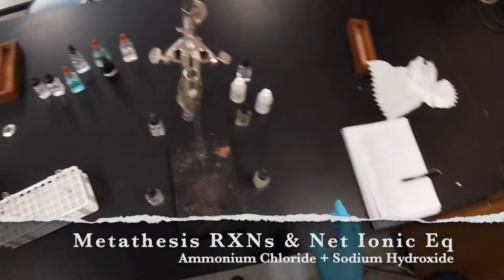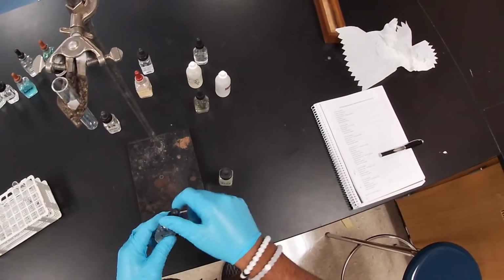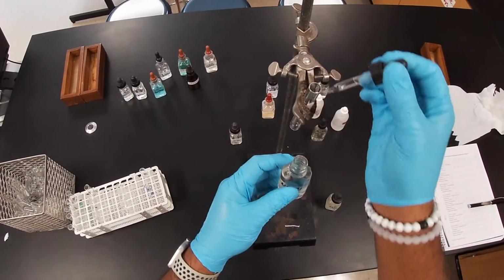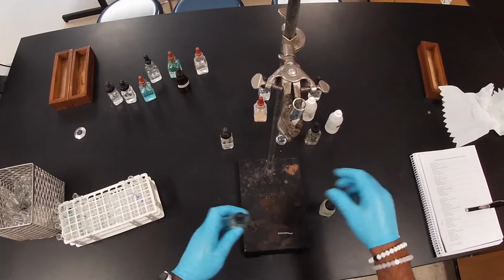The next reaction we're going to do is that of ammonium chloride and sodium hydroxide. And so we're going to go ahead and get that reaction done. So we got our test tube, ammonium chloride, dropper full.